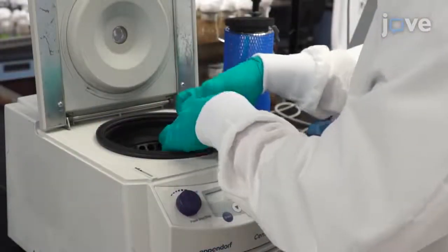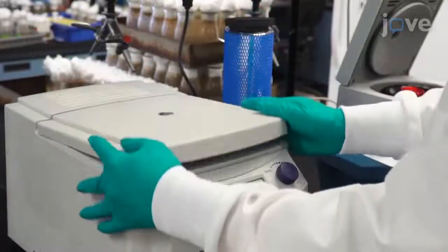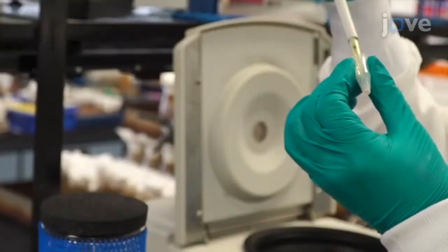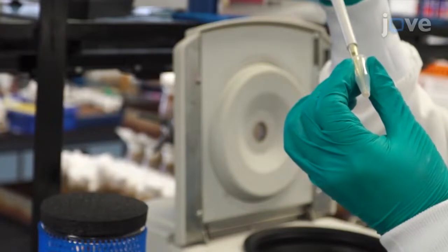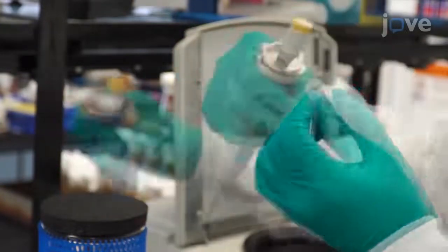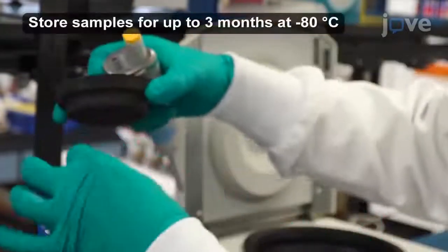Centrifuge the samples at 2000 g for 1 minute at 4 degrees Celsius. Remove all residual solution using a 200-microliter pipette and immediately freeze the sample in liquid nitrogen.